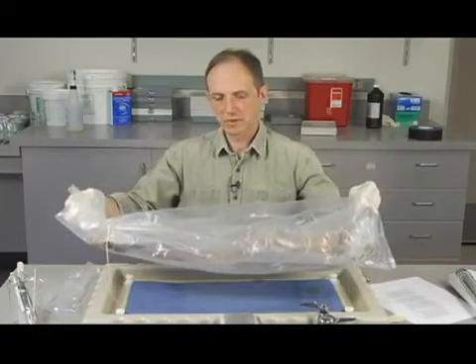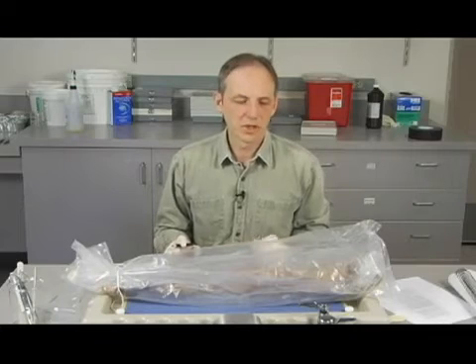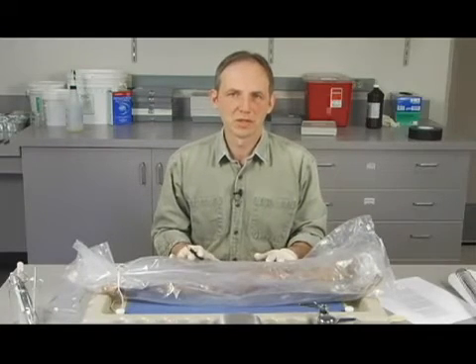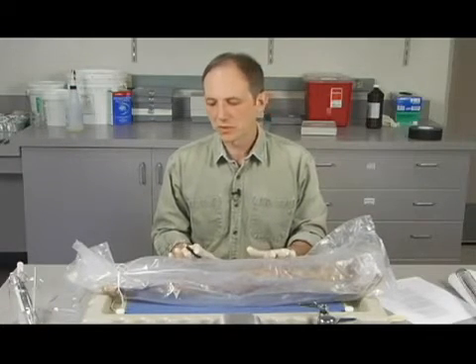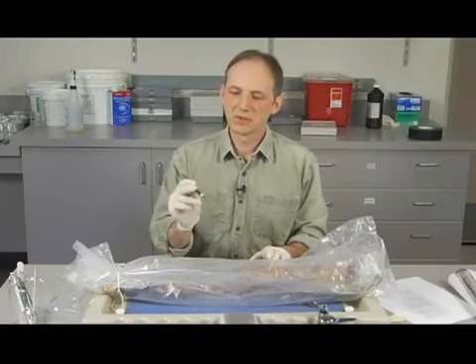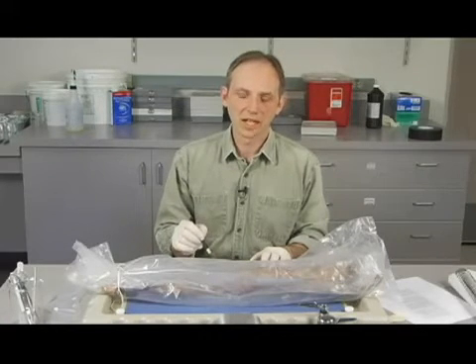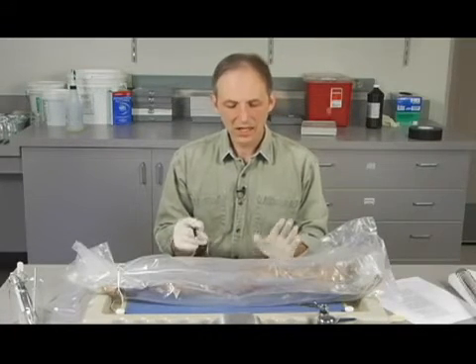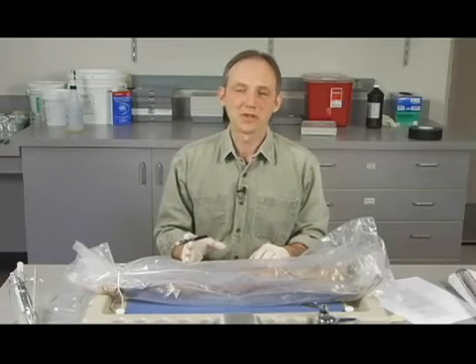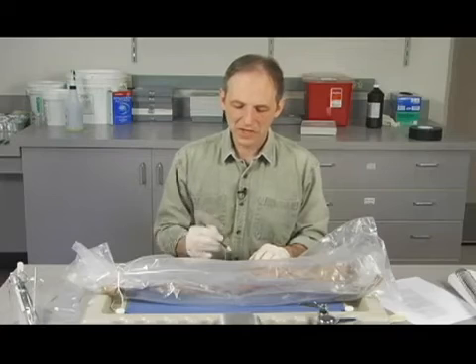That's the idea. Okay? The other thing that you can do at this point, and this is actually important for you, this will be your specimen. You'll be working on this with other people, but you're going to need to keep track of your cat. So we have these grease pencils, and basically what you want to do is write something on the bag. I try not to censor this too much, but basically you want to put some information that identifies this as being your cat.